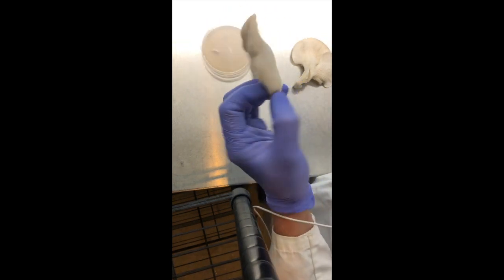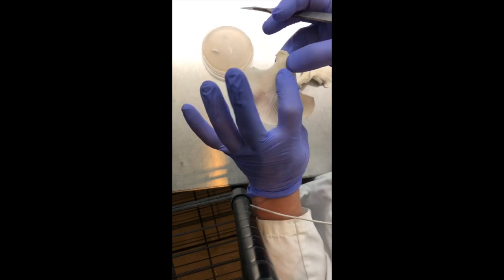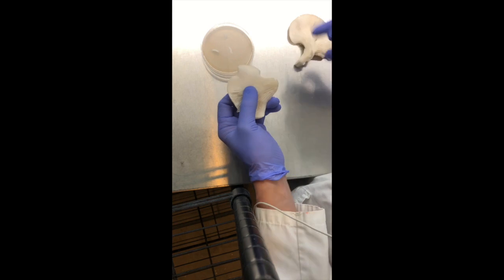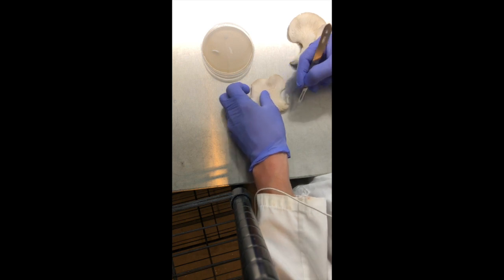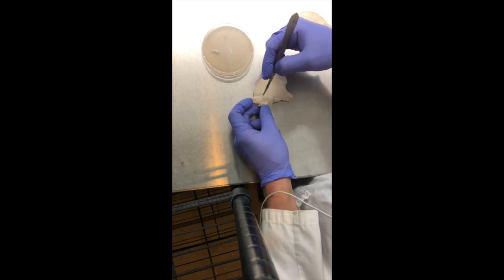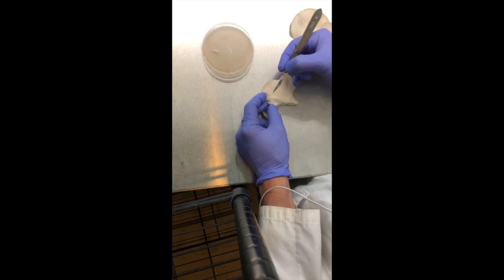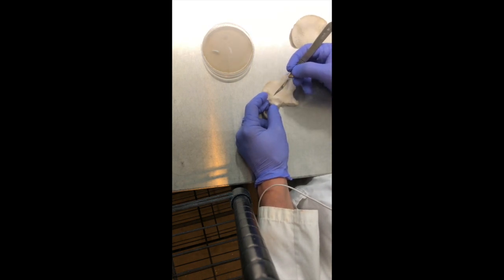I've got two cuts on that plate already, and this looks like another pretty good mushroom that I'd like to clone. So I'm going to make an incision and then make my cuts from within that mushroom. I just cracked into the tissue and I'm holding that dense region with my left hand, then making a couple of angled precision cuts — that little slice will be sterile tissue to put on the agar petri dish.